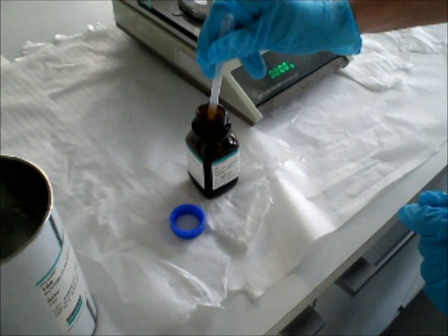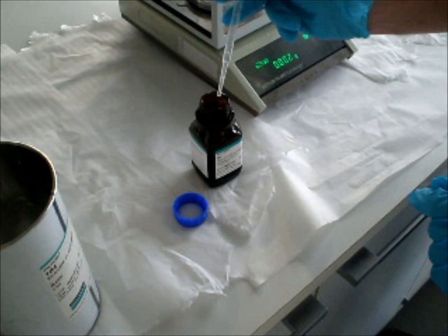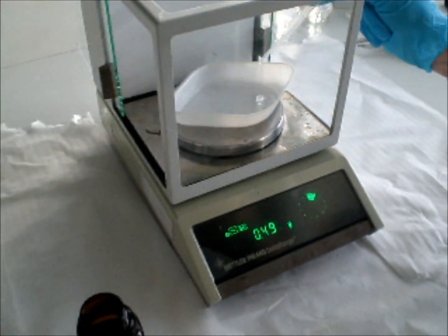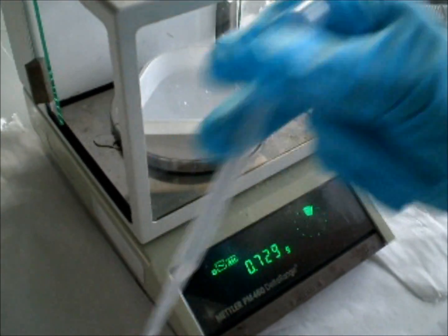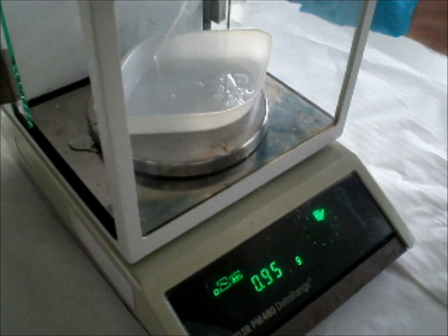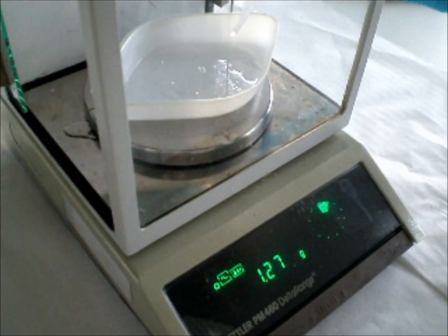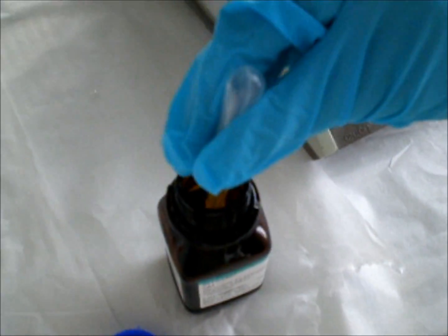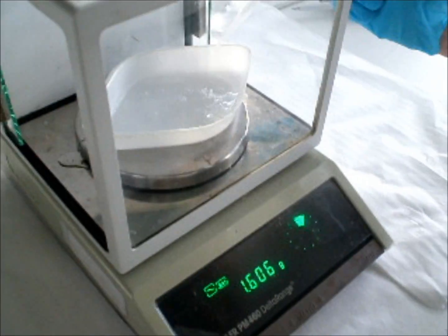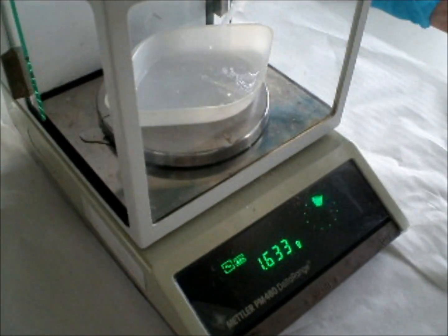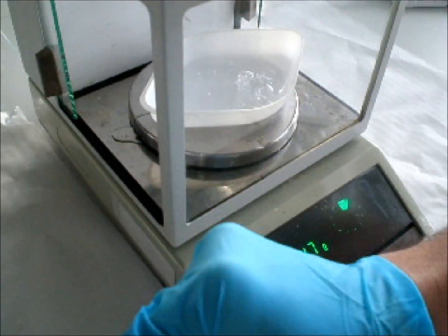We will make it zero again, and then put hardener around. But I will put less because I don't want the silicone to be very hard, to be more elastic, so I will just put 1.7 grams.